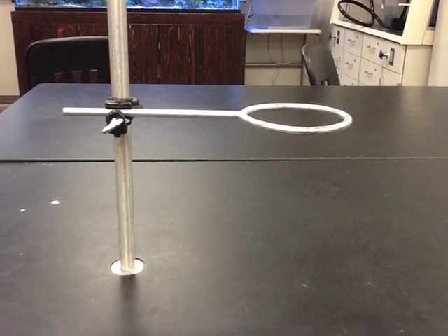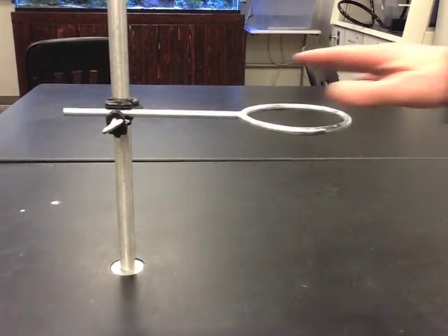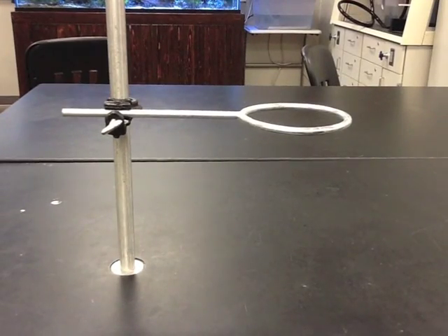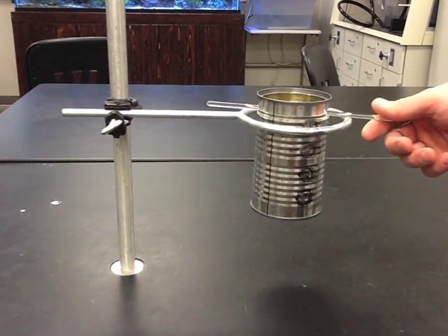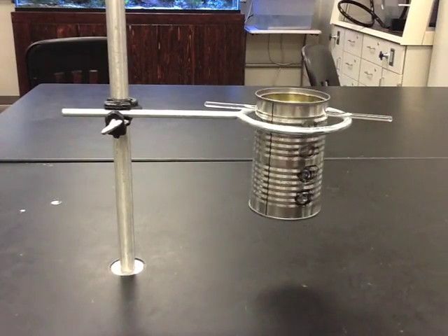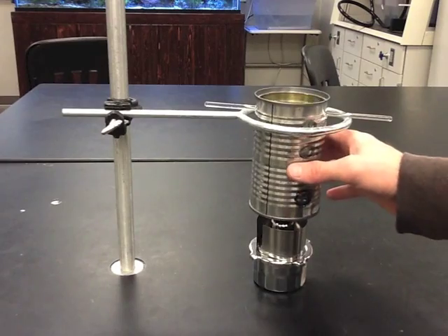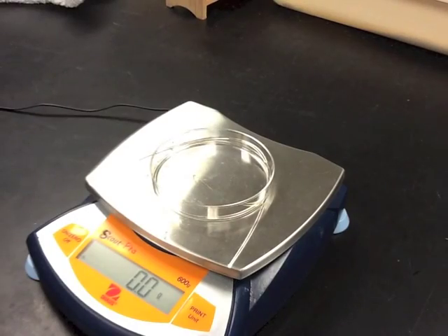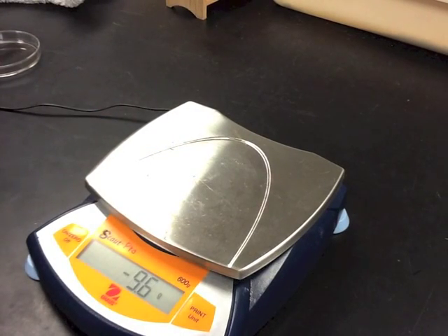Let's go ahead and set this experiment up to burn the alcohol first. Set up a ring stand with a clamp, a metal can with a stir rod through it to support it, with the alcohol burner right below that. First, let's go ahead and record the weight of the can when it's empty.